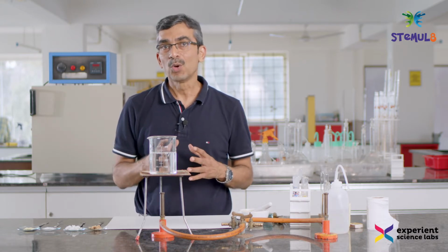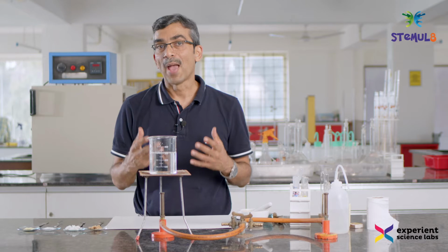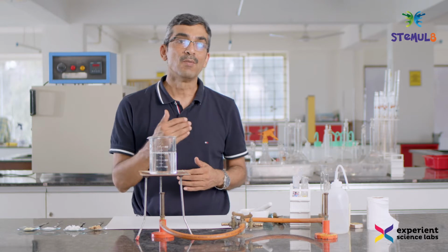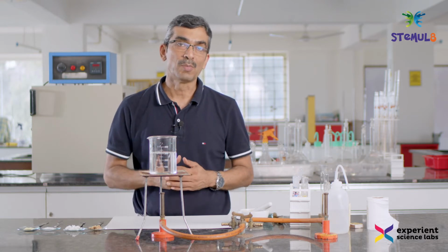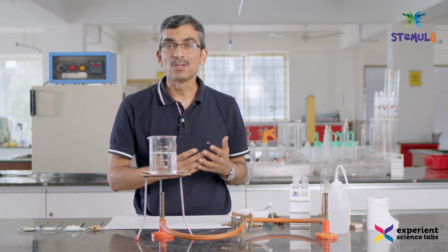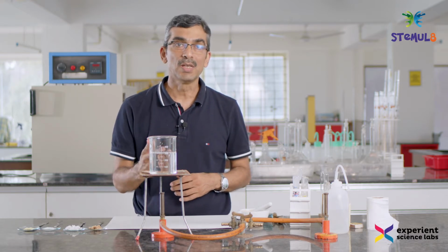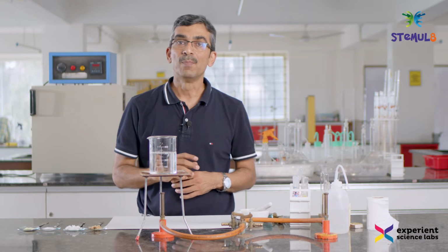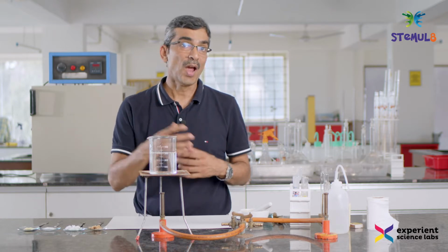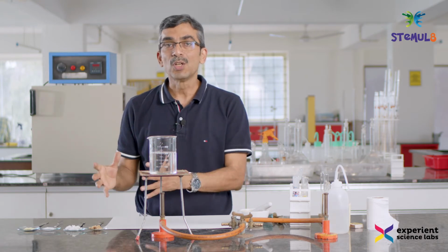So in today's experiment we are going to look at which macronutrients the food that we eat has, and also among the micronutrients we are going to look at vitamin C, whether it is present or not. Now when you go and buy any food packet, let's say any snacks or a chocolate, on the back of the envelope you will see the food nutrition label. It indicates how much protein, how much sugar, how much carbohydrate or how much fat or micronutrient is present in the food. We are not going to get into the quantitative analysis.